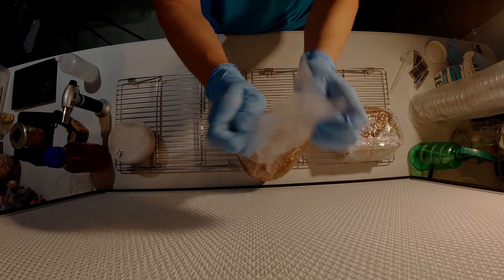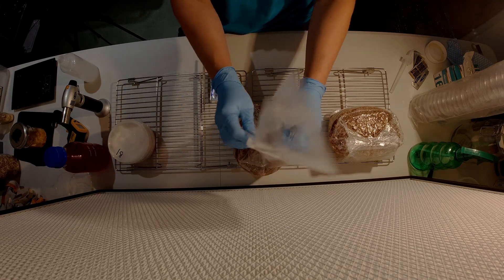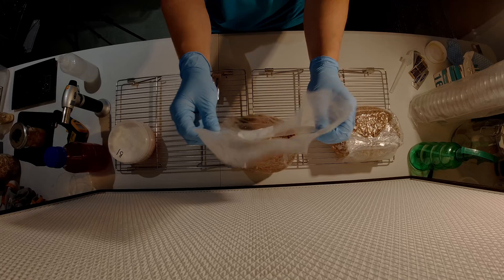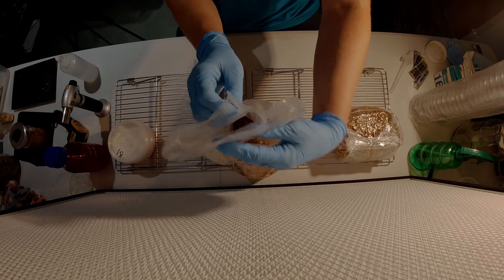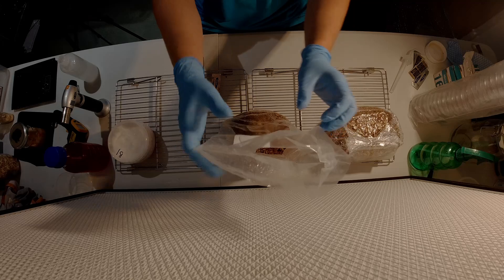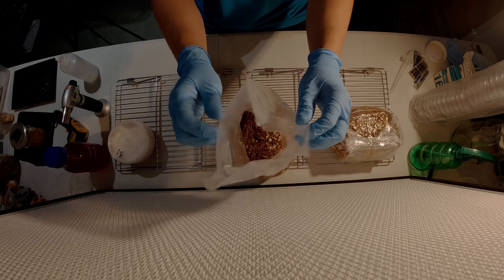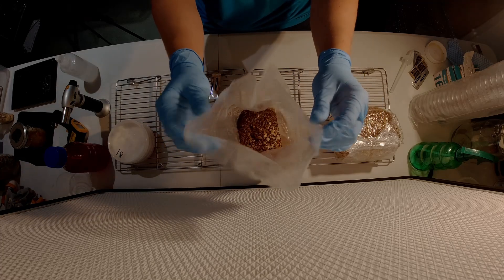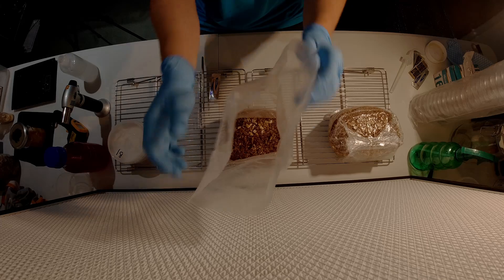If you look at the screen now, in a still air box I would probably stop here — that's about as much opening as you're going to need. A small opening which you can drop in a fairly large segment of agar is ideal. Making a large opening can be tricky and causes a lot of unnecessary movement as you try to fully open the bag.